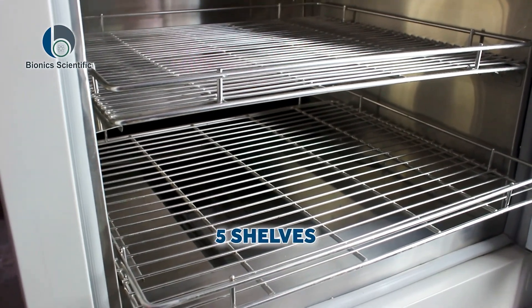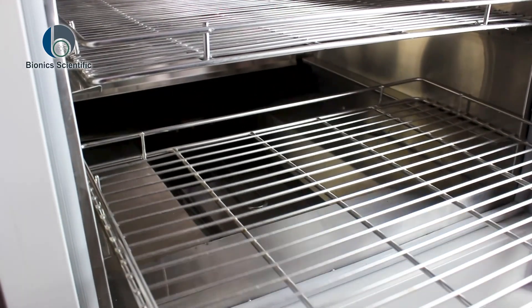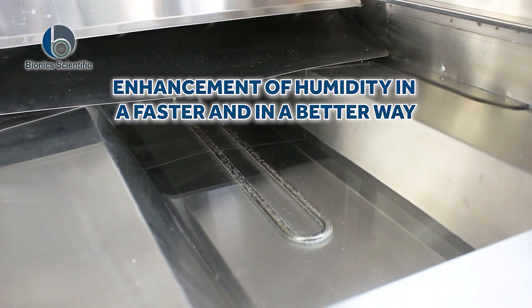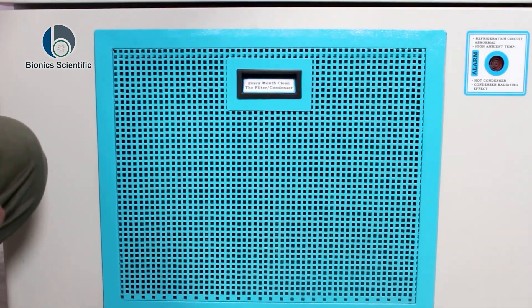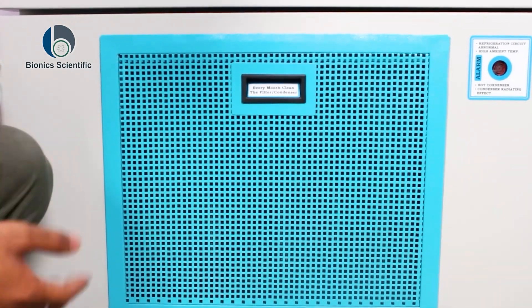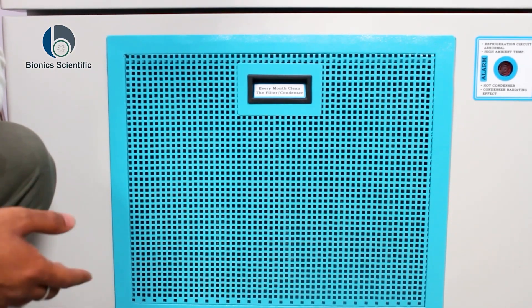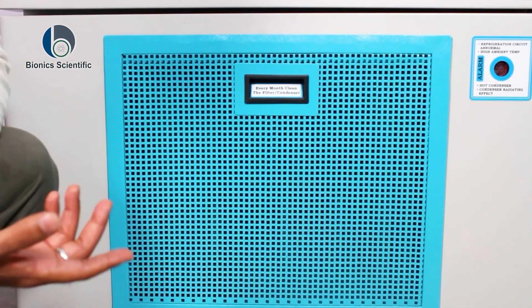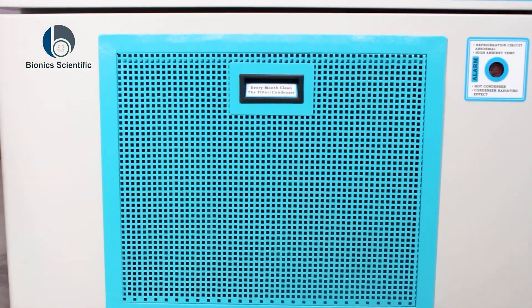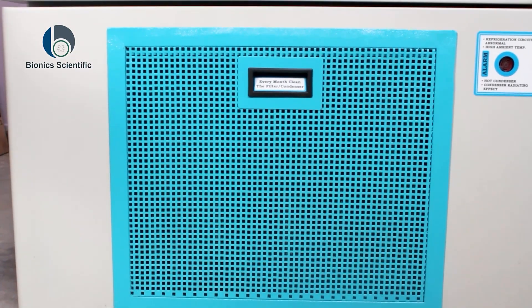In the seed germinator, there are five shelves provided along with this chamber. This component is for the enhancement of humidity in a faster and better way. As you can see, it is written here: 'Every month clean the filter condenser.' This is because dust can enter while the machine is running, so every month you must clean the filter or condenser. Above this, there is an alarm — it will create a beep sound indicating that something is wrong and the filter needs to be cleaned.